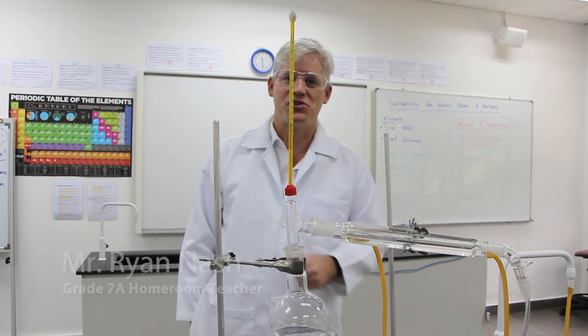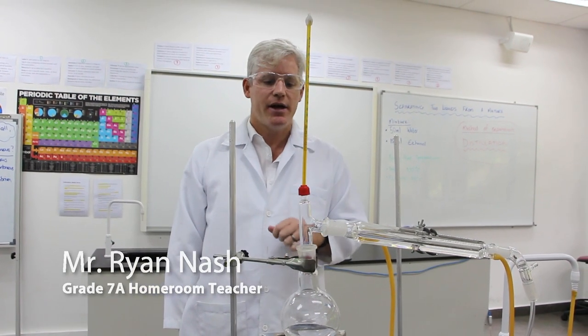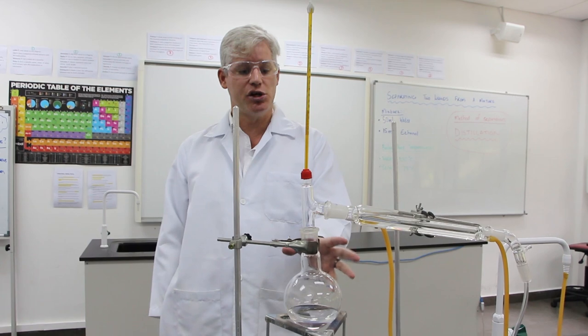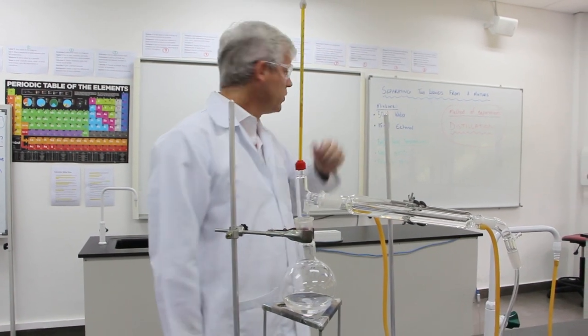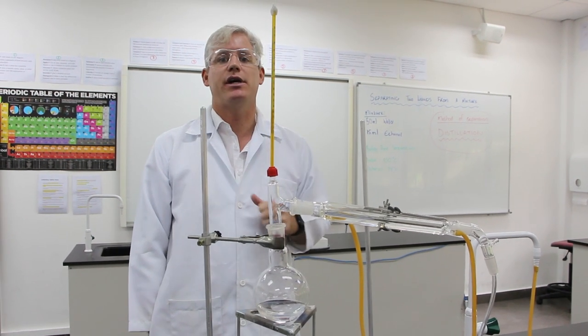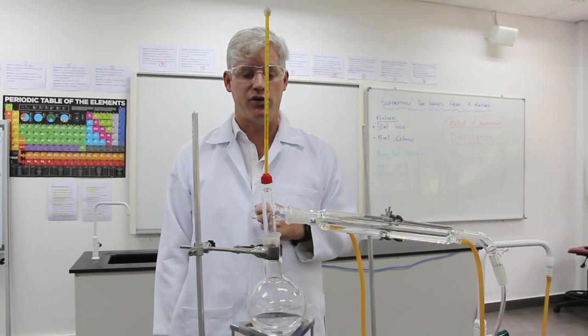Thanks Ginger, my name is Ryan Nash. I'm a grade 7 science and math teacher at Sunway. In front of us we have a solution of water and ethanol. As Ms. Ginger explained earlier, water has a boiling point of 100 degrees Celsius and ethanol 78.3 degrees.